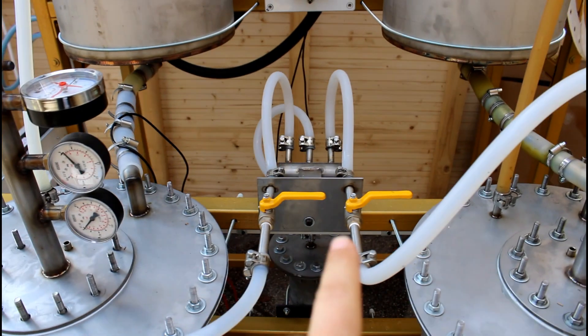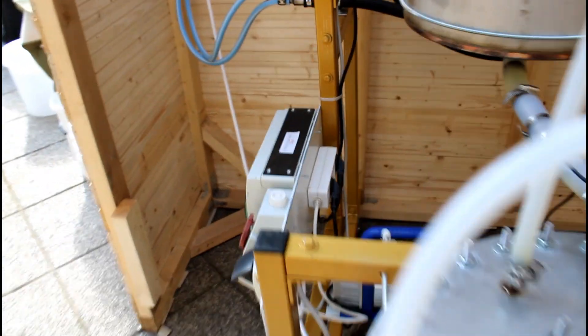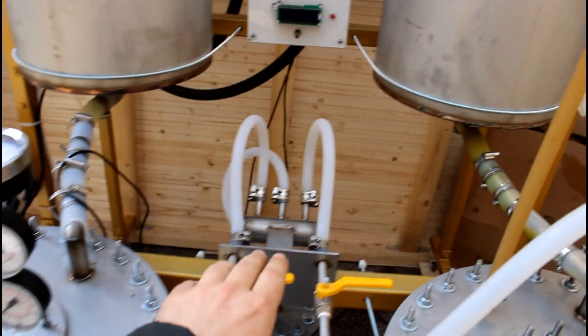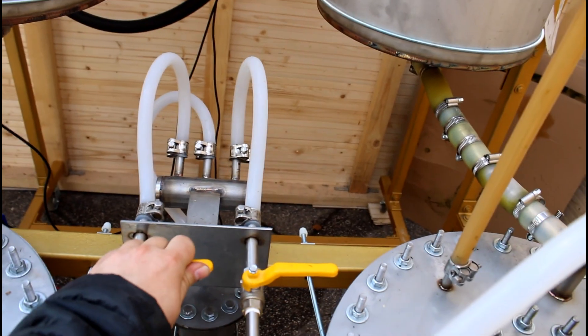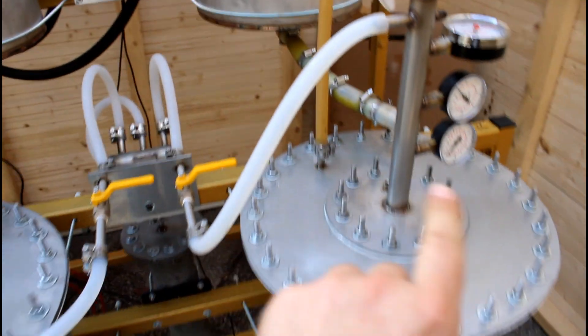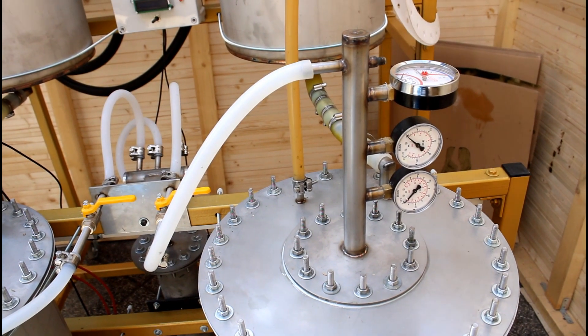What you can see here is the vacuum system. So down there is the vacuum pump. And so the vacuum comes here. And here I can regulate the vacuum from the left side and also from the right side, to evacuate both systems individually.